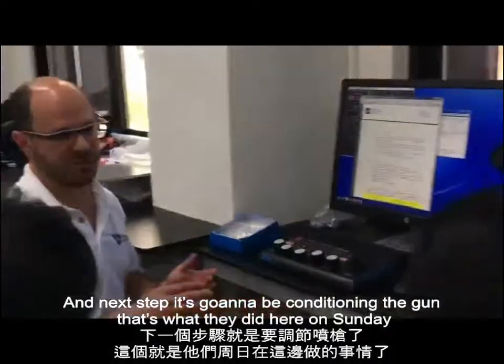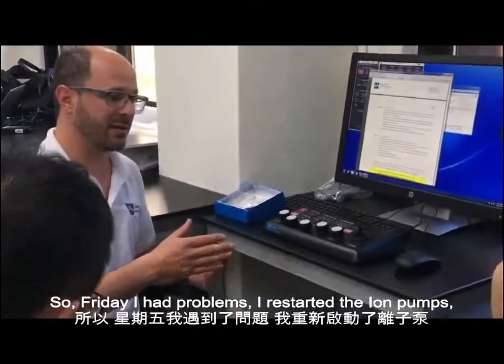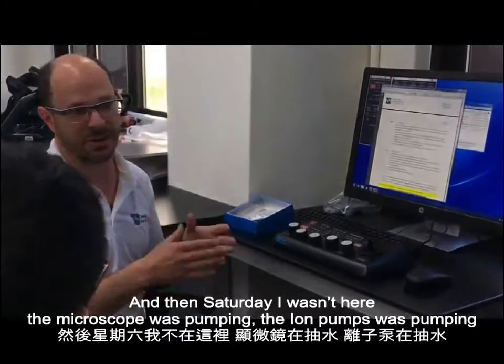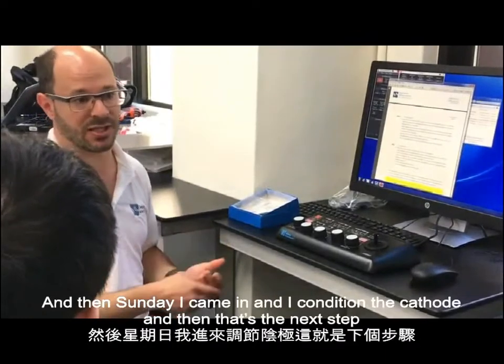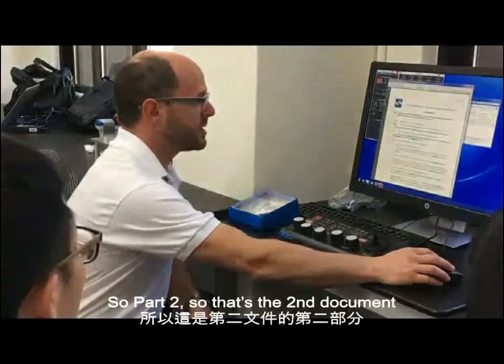And the next step is going to be conditioning the gun. That's what I did here on Sunday. So Friday, we had the problem, I restarted the ion pumps, and then Saturday I wasn't here, the microscope was pumping, the ion pumps were pumping, and then Sunday I came in and I conditioned the cathode, and that's the next step. So part 2, that's the second document.